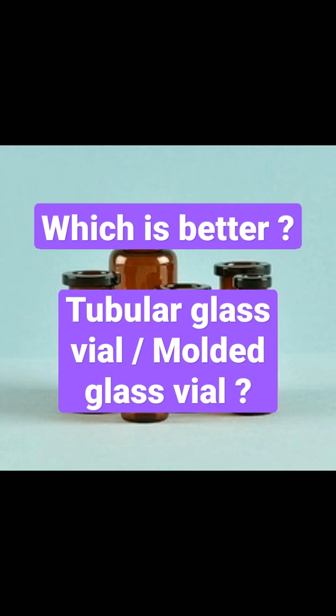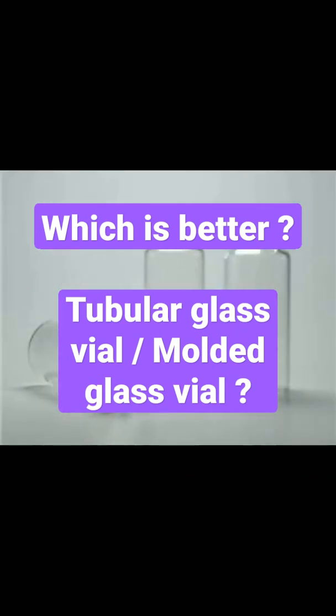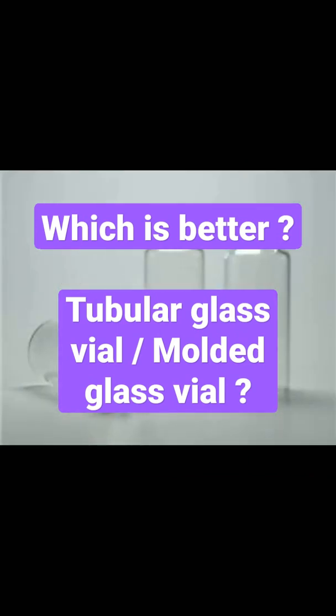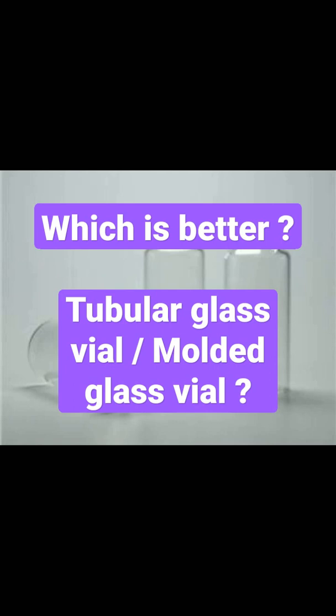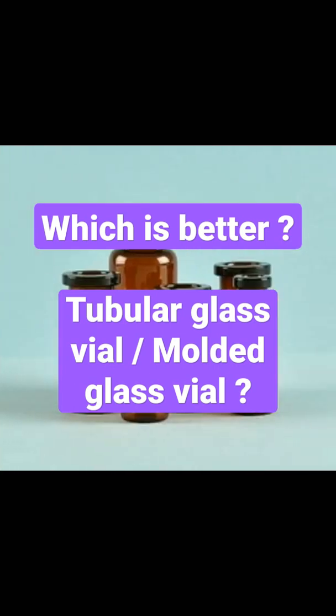Tubular glass vials' thinner and more even wall structure also allows for greater clarity, ideal for visual inspection of the products.